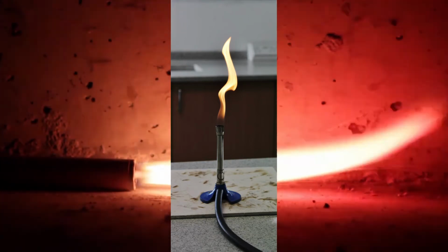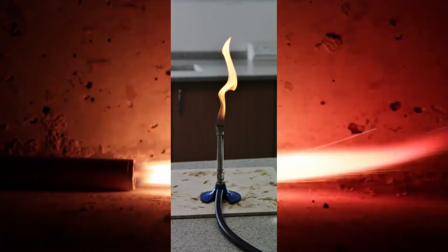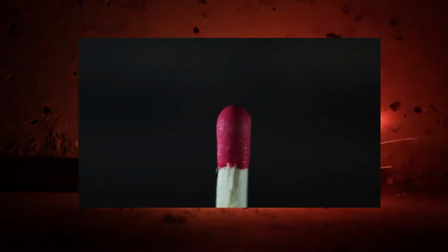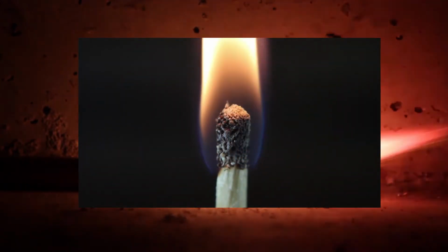All elements burn at different temperatures and show different colors as they burn. Some are more unique than others, and some are more apparent than others. The test itself involves introducing a sample of the element or an unknown compound to a hot, non-luminous flame, and watching what color the flame turns into.